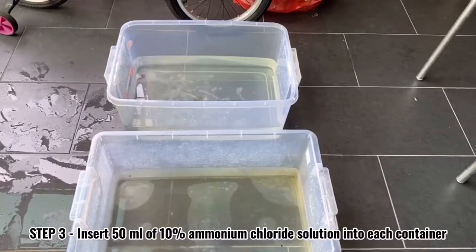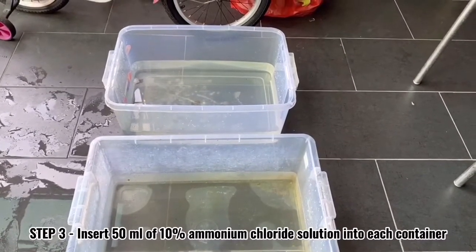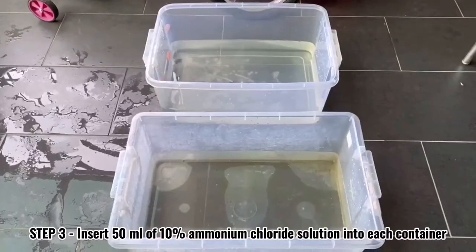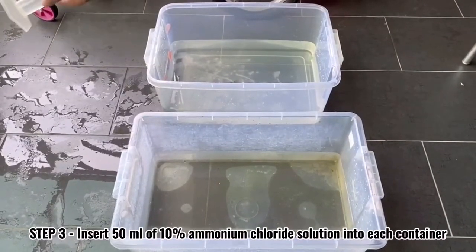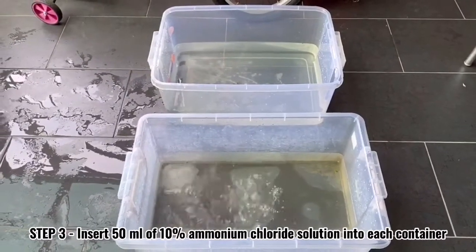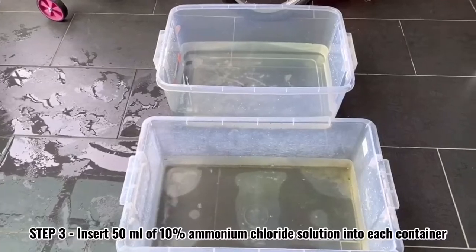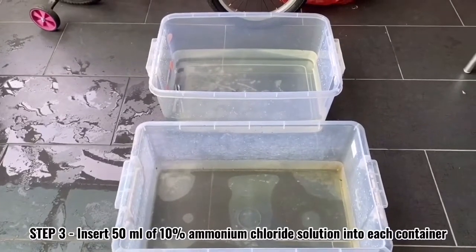Step 3: insert 50ml of 10% ammonium chloride solution into each container. Clean it.